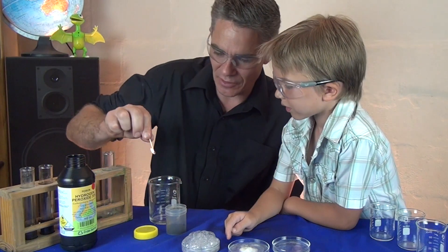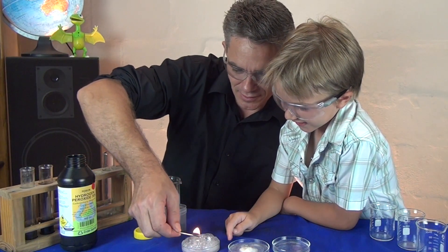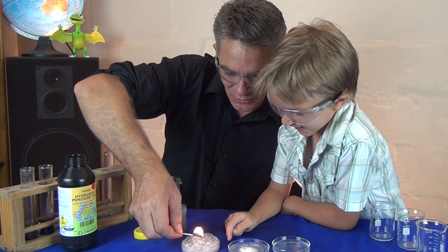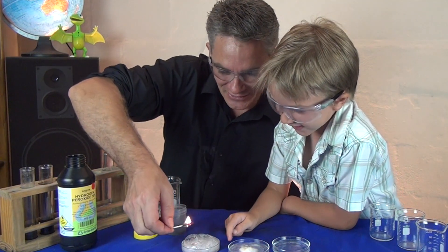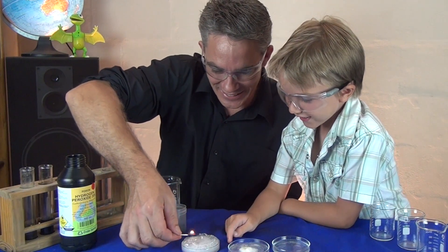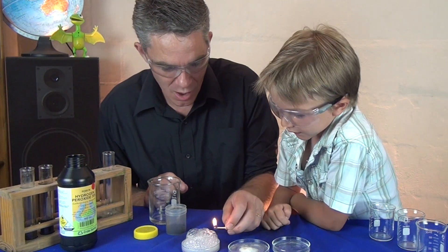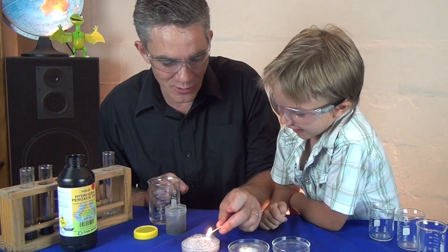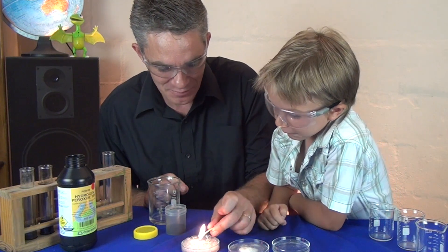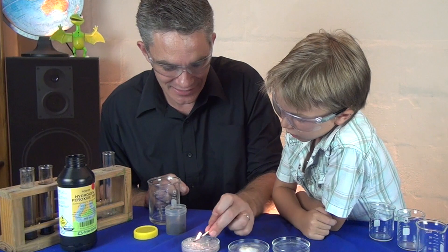It will happen if I bring a match to it. See how it's sort of burning a bit brighter when you do that Sam? They're making a firework noise. It is. Let's have a look. Because those bubbles all have lots of oxygen in them. So they're burning quite well aren't they?